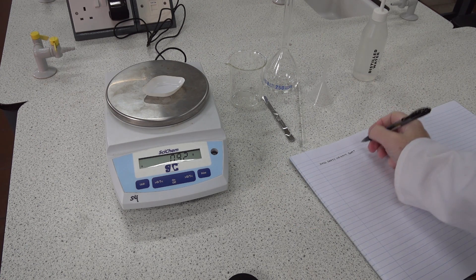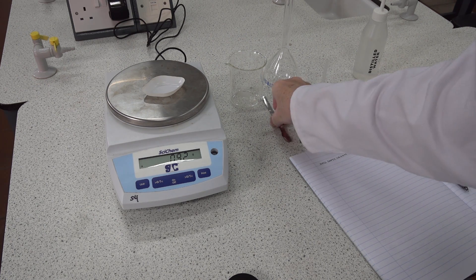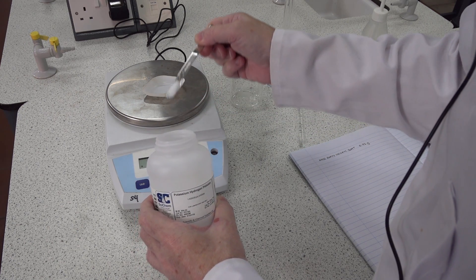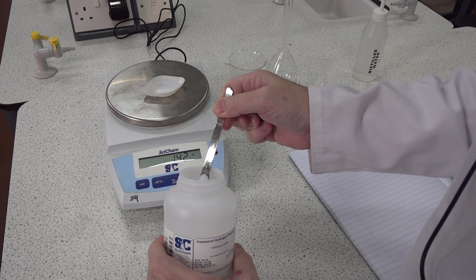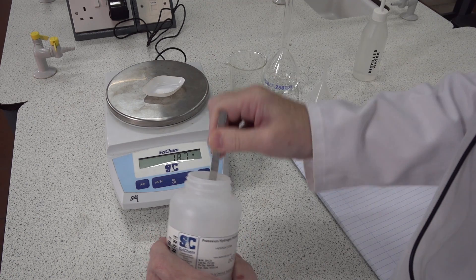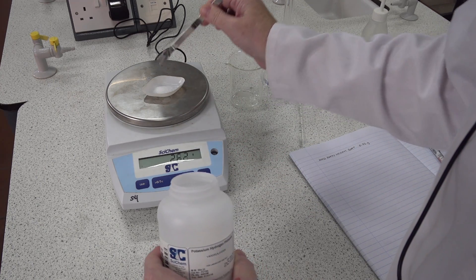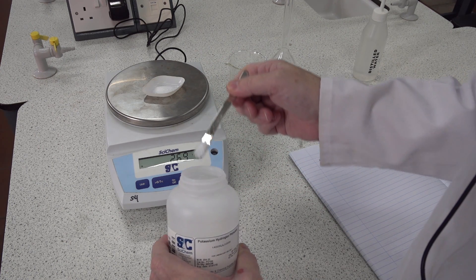The initial reading is 0.92 grams. The ILPAC course reminds the reader that potassium hydrogen phthalate is a stable compound, doesn't react with the air, it has a high molar mass, is soluble in water, and when we use it in a reaction it reacts quite rapidly.